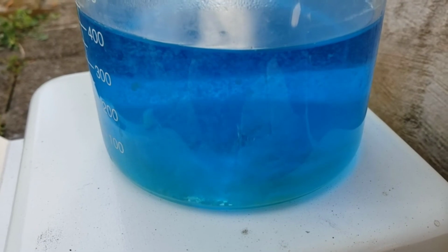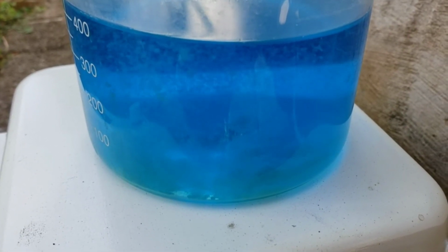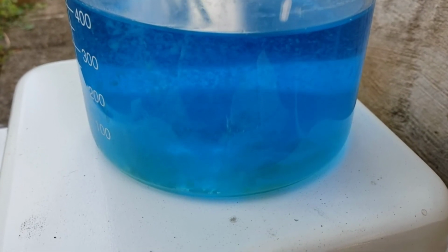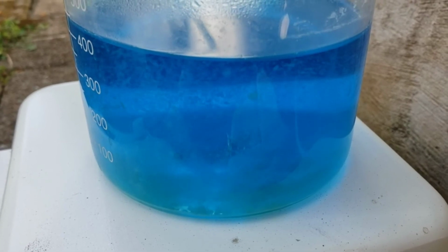And a bit off topic, but there's something that I noticed here that I think is pretty cool, which is the bits of copper acetate that are in the solution, floating up and then around over the top, forming almost ring-shaped sort of convection currents going up and down within the beaker, which I think is super cool. And a little bit similar to what goes on inside of the Earth, which is a little interesting sort of science lesson thing.